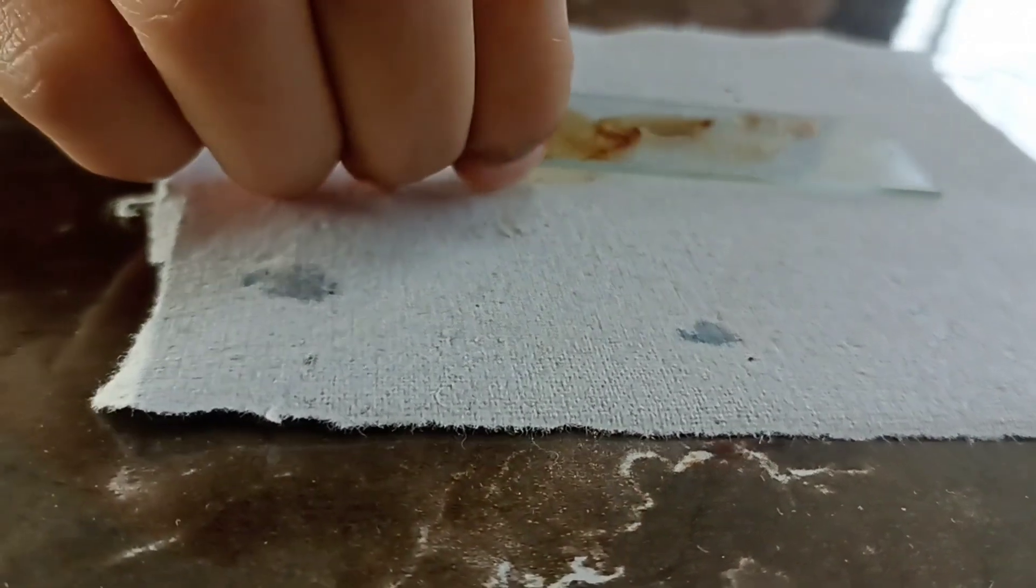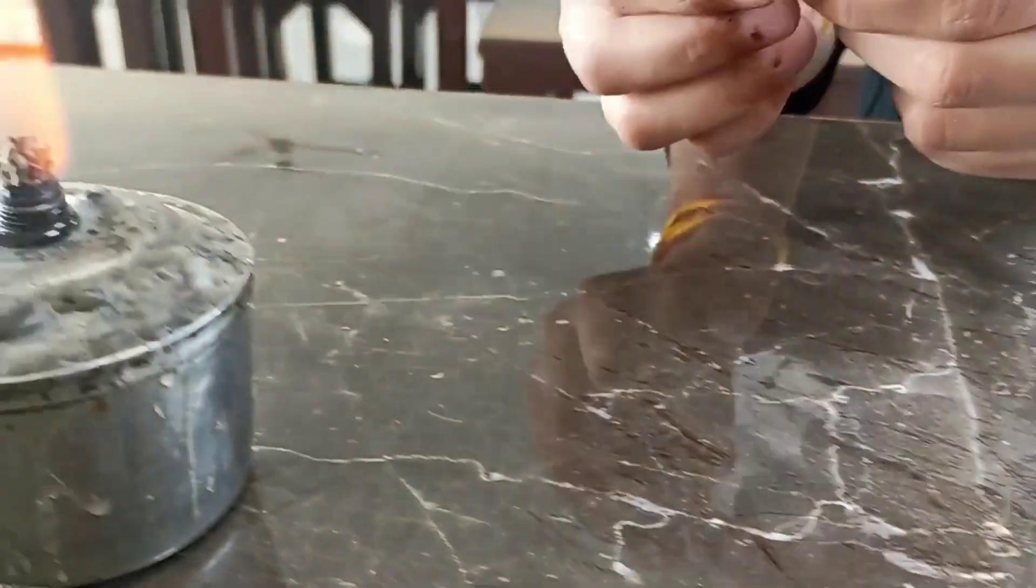After this, heat up the slide on the burner until it's warm.